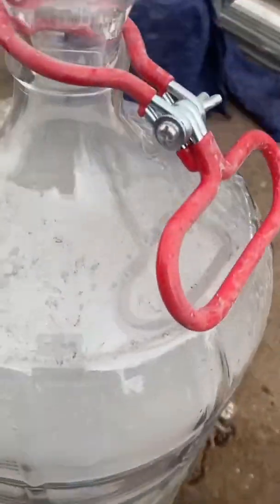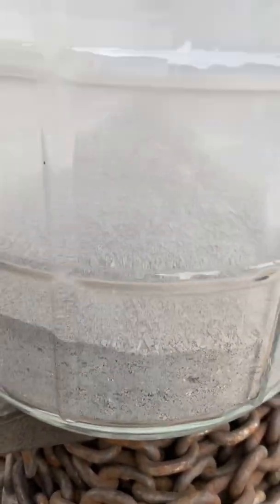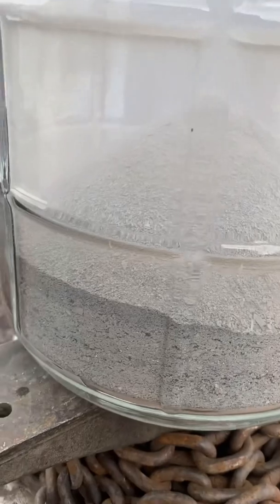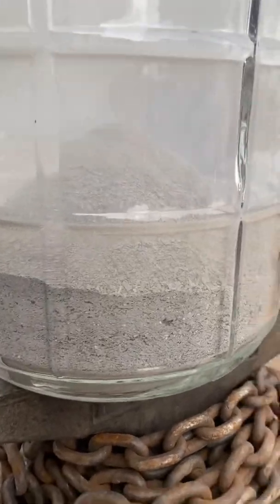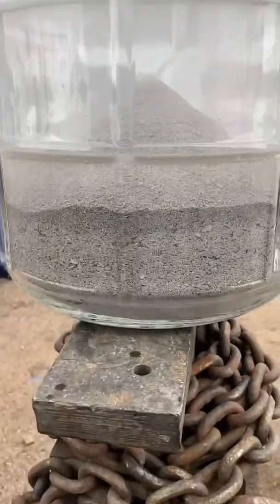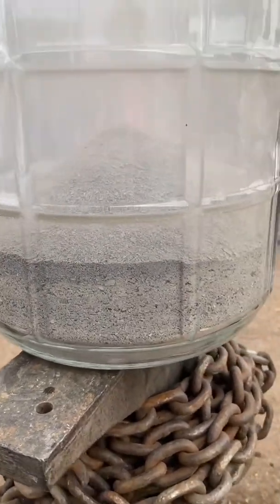Here's our pile of substrate, and I'm going to add some hydrochloric acid — roughly a gallon — and see where we're at from there, make sure it saturates everything. And then I might add some nitric acid, about one liter, slowly, so it won't explode on you.